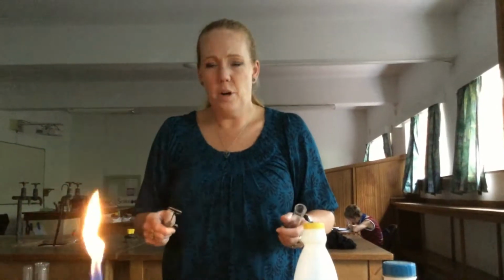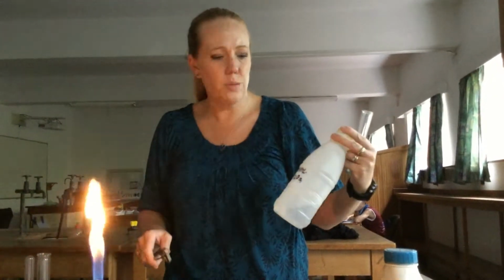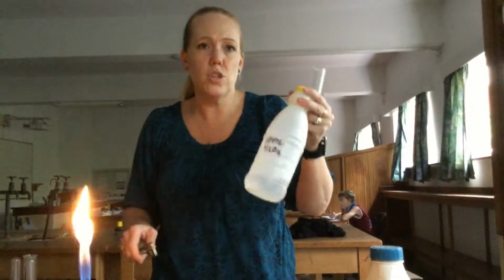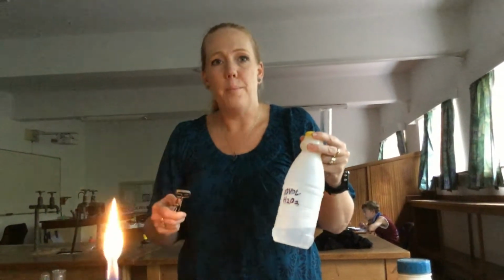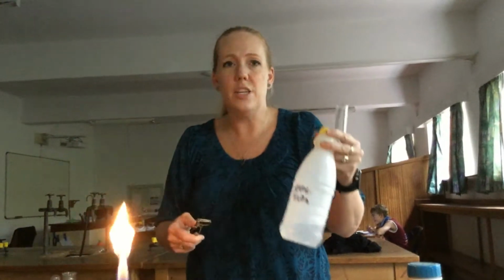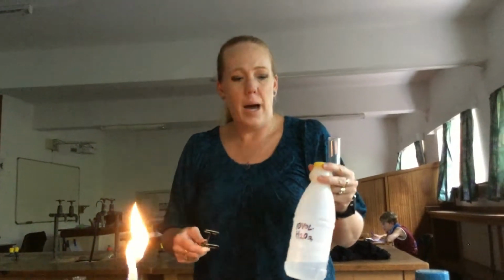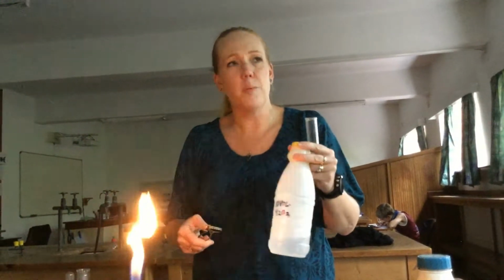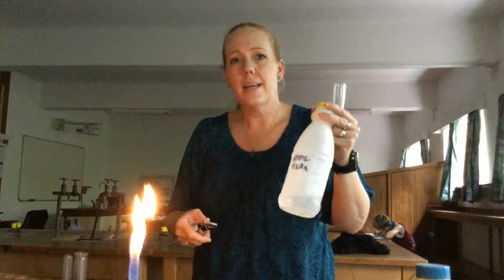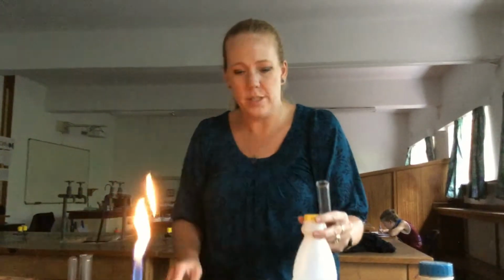In this last experiment, we're going to talk about the decomposition of hydrogen peroxide. Hydrogen peroxide is a chemical that our bodies and lots of organisms produce and need to break down. It's often broken down by an enzyme called catalase, and in biology you might do an experiment with potato and catalase, showing that potato cells contain catalase and can break down hydrogen peroxide.